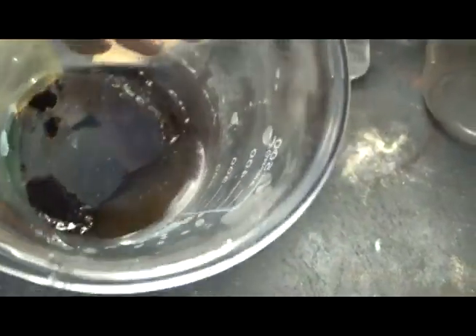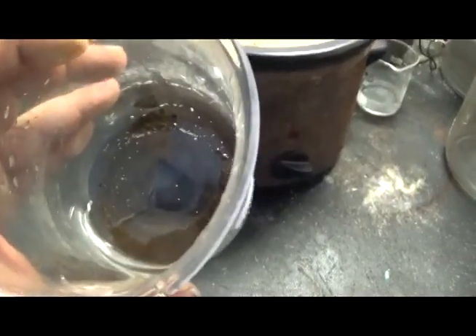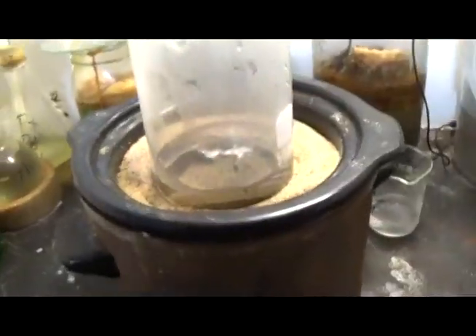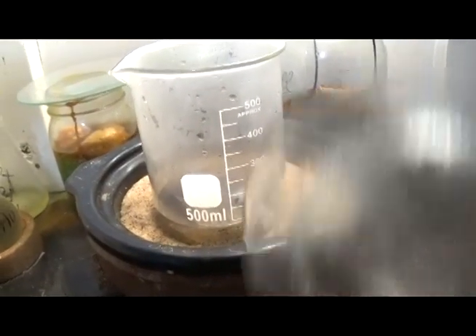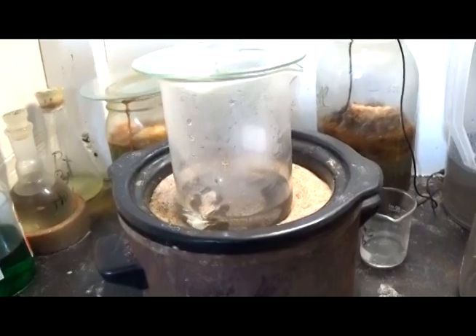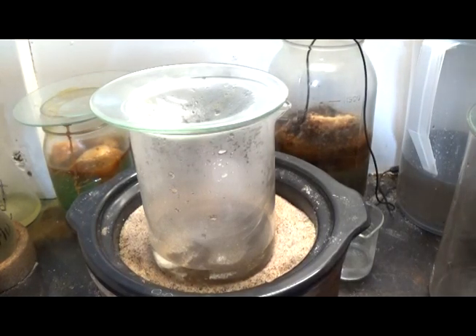All right, we're going to get this in aqua regia. That's good heavy gold. It's not that fine fish crap that I was fearing. All right, we're going to put this in aqua regia and refine it again. We're going to see again how little nitric it takes to dissolve this gold. Right now we have right at, I don't know, about 90 milliliters of hydrochloric acid. And we're going to start laying the nitric to it. We're going to start off with 8. Yeah, let's start off with 8 milliliters concentrated nitric acid. Okay. That's right at between 8 and 9 milliliters of concentrated nitric acid.